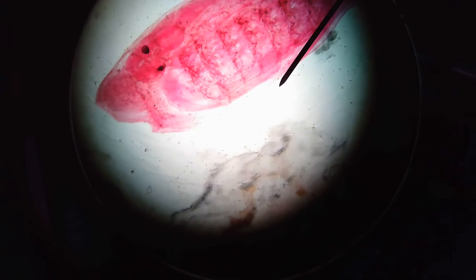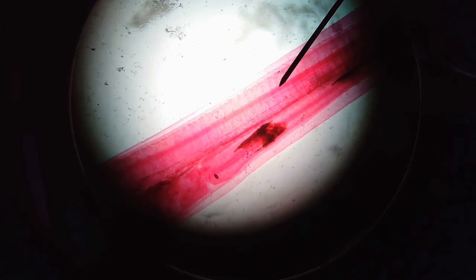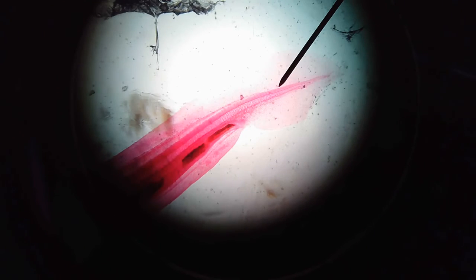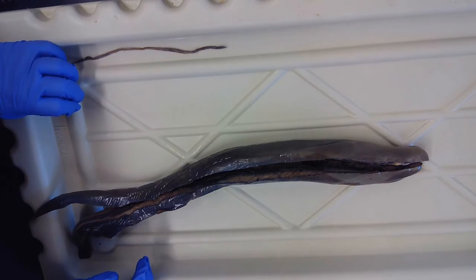Also here, we have the postanal tail, which would be these parts here, all the way exceeding past the midgut region. The more interior you go, you can come across that caudal tail. You can see right back there behind the needle. You can see the notochord, and the spinal cord extends all the way to the tail, and that would be the postanal tail region.